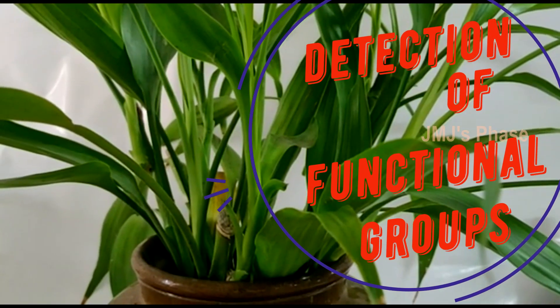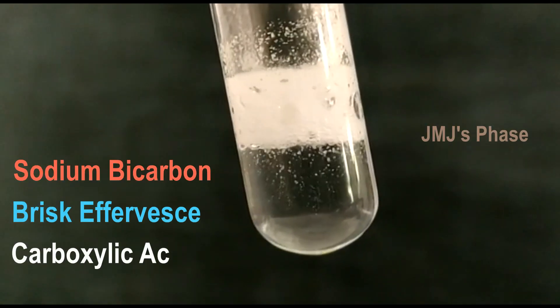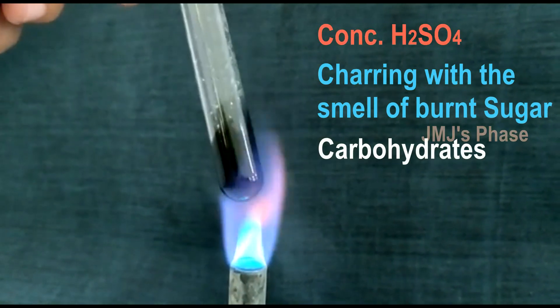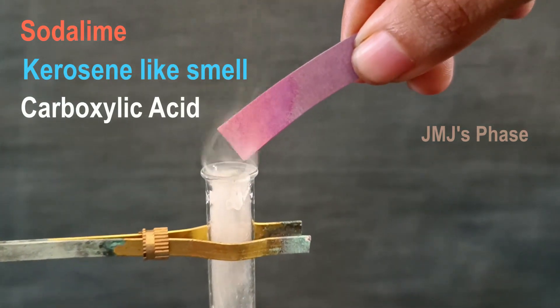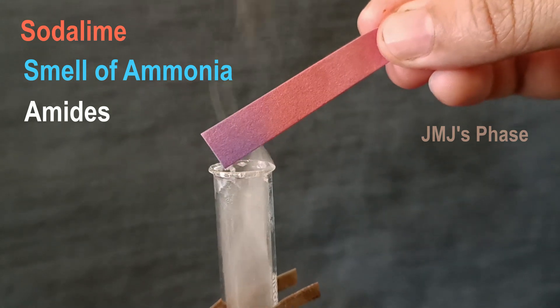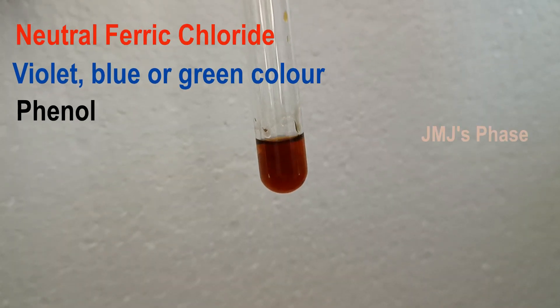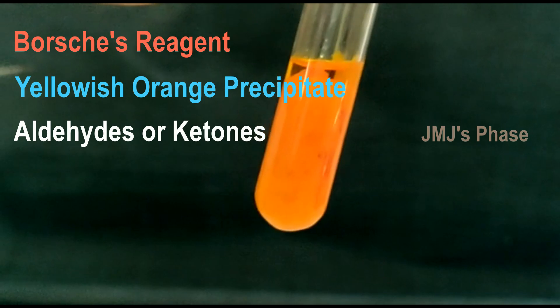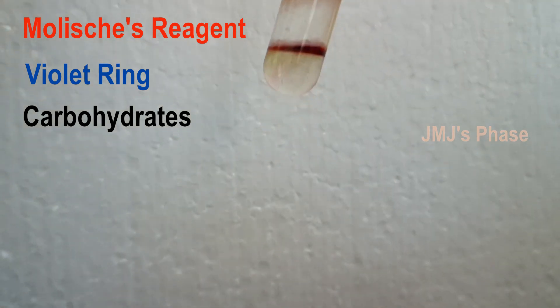We have seen how to detect the functional groups present in a given organic compound by using sodium bicarbonate, 20% NaOH solution, concentrated sulfuric acid, soda lime, metallic sodium, neutral ferric chloride, Brady's reagent, and Molisch's reagent. Hope you understood all the experiments well. Thank you.